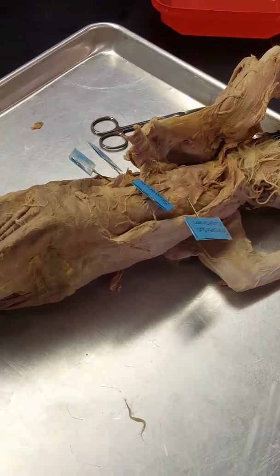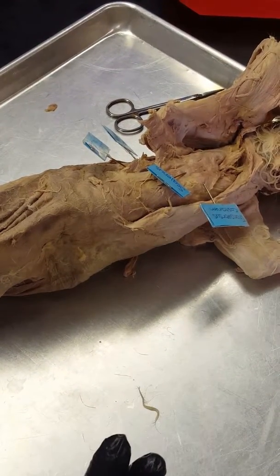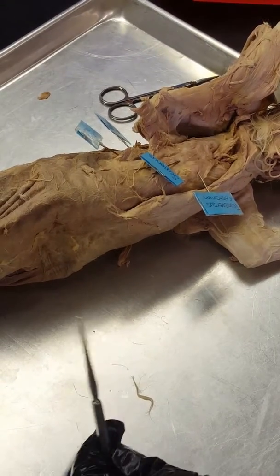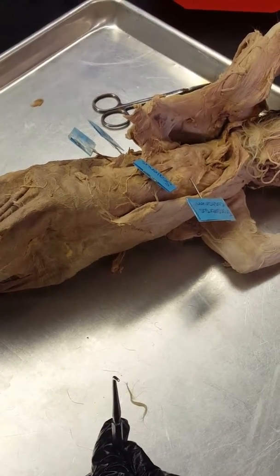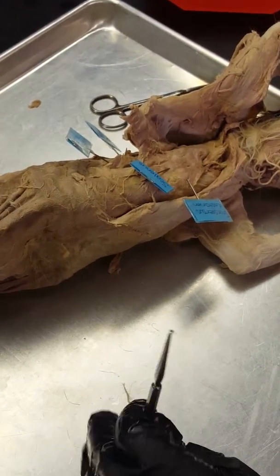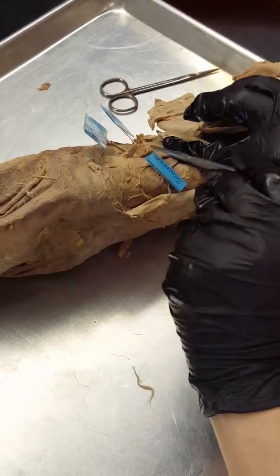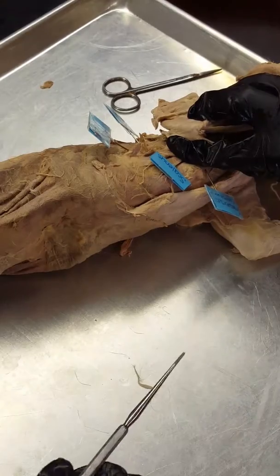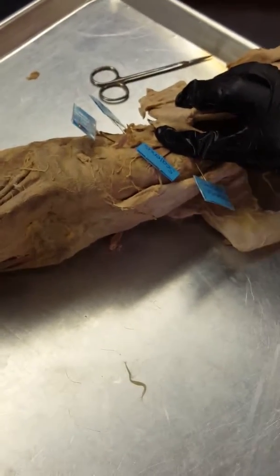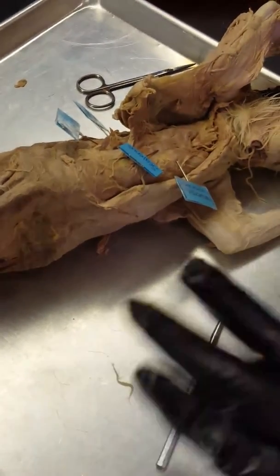You have to keep in mind there are three layers, and make sure you know which layer you're dealing with. They're all deep, so: serratus ventralis is the first layer, external intercostal is the second layer, and internal intercostal is the third layer. To ID the internal you'll be looking for a tag that's got ripped-up tissue beside it. Now I need everyone to dissect your cats because I need to use them tomorrow, so go and do these things and then we'll be finished.